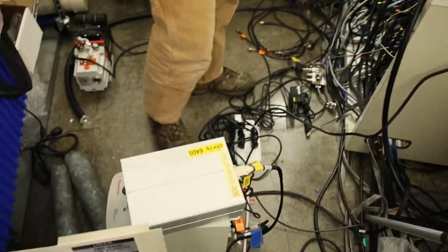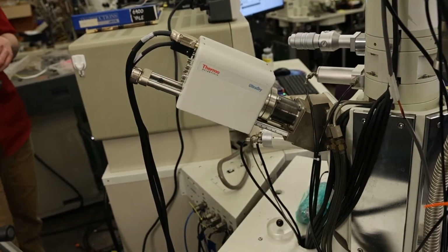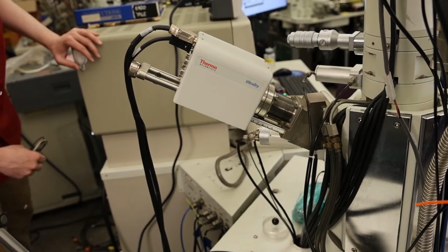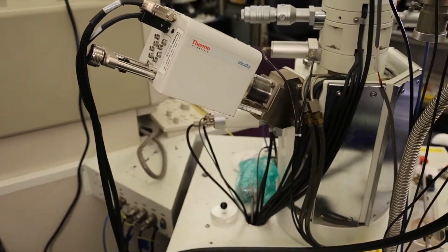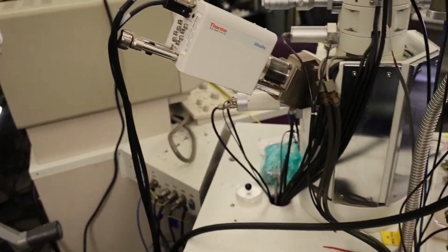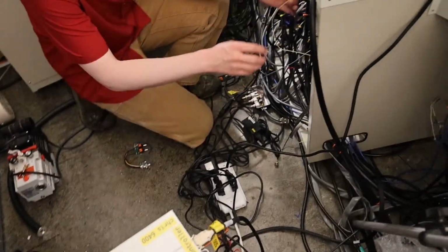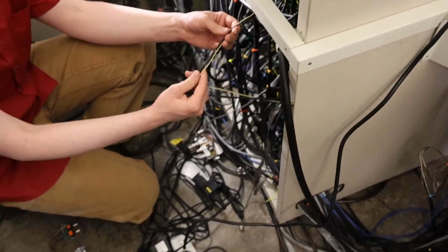So if you want to show the X-ray detector, that's the Thermo UltraDry, what is this one? 132 eV SDD, silicon drift detector. So that's what we're doing our X-ray analysis with. We've got the NORAN System 7 down here. Currently, if you want to come down here, this is our cable from System 7.